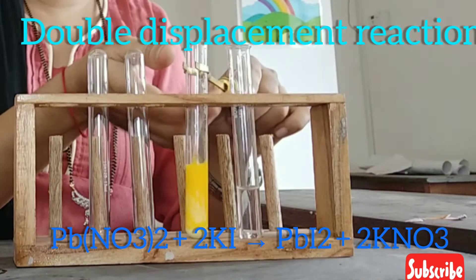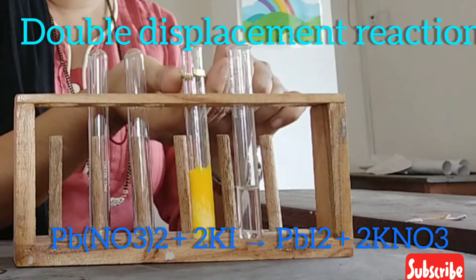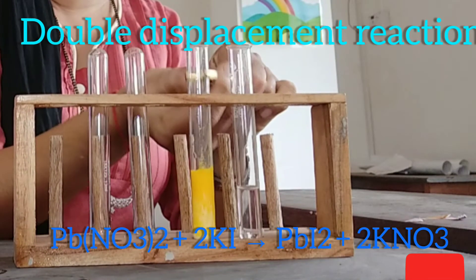The reaction between potassium iodide and lead nitrate is also called a double displacement reaction.